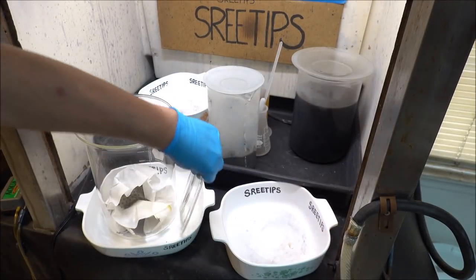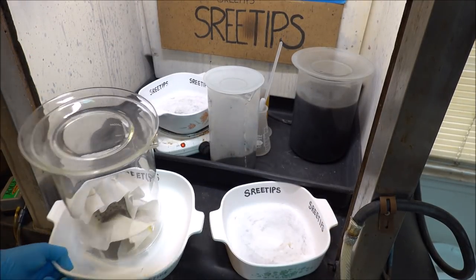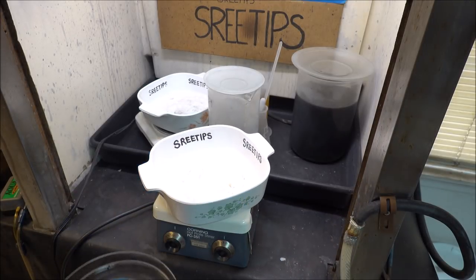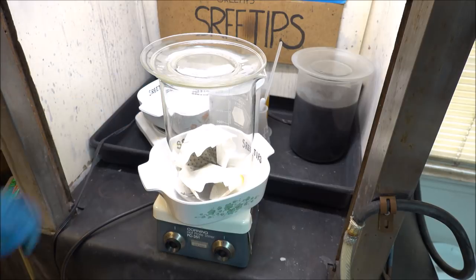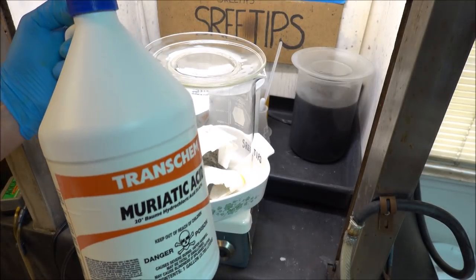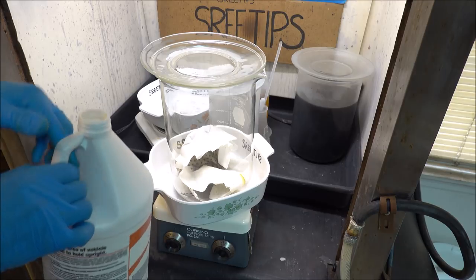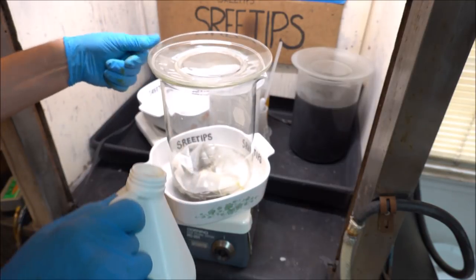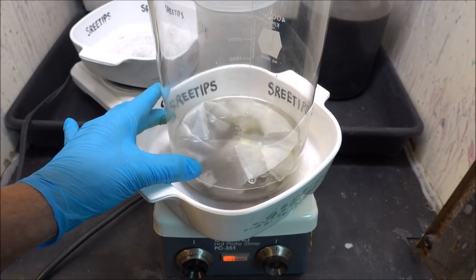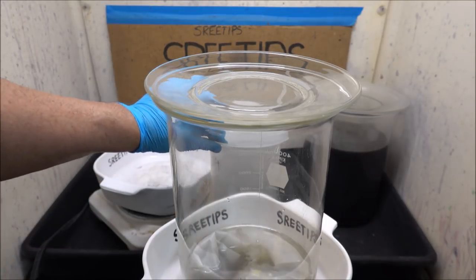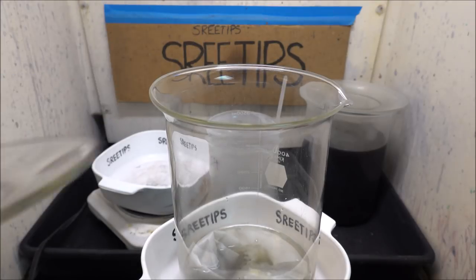For this part of the process, I'm going to use a stir plate. I've got a stir bar here, the biggest one I've got. I'm going to start the reaction now. I'm going to add some hydrochloric acid here, probably half a liter. Start stirring. I've got the filters on the stir plate, some hydrochloric acid. Now I'm going to start slowly adding the material out of our beaker here.